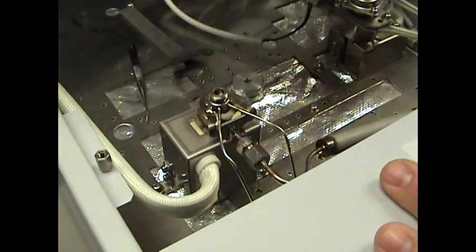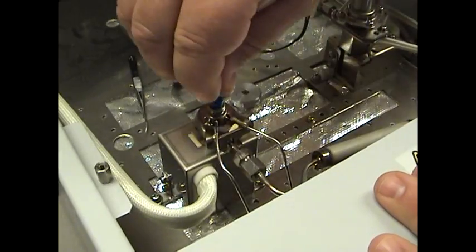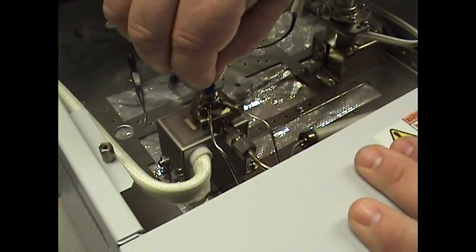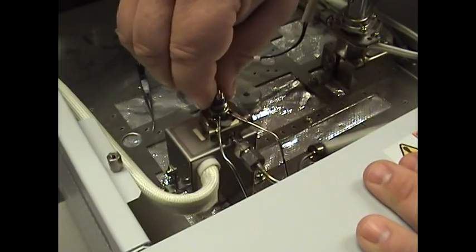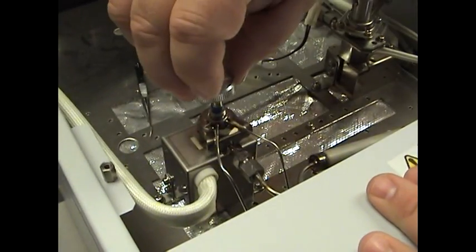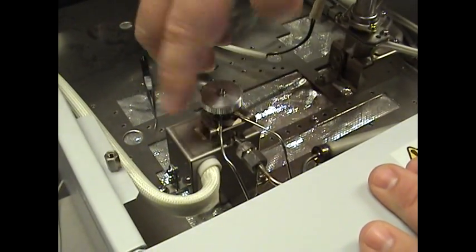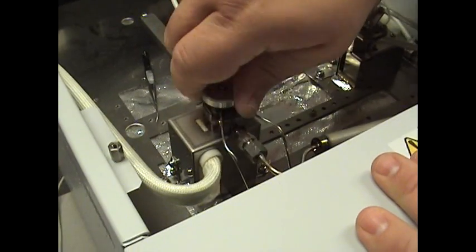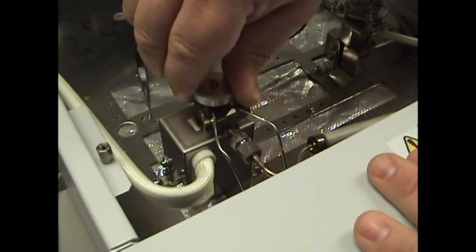Next step, once again, put your septa in as in the previous video. Put the injection port needle guide, the knurled nut, screw it down, back it off a half to a turn.